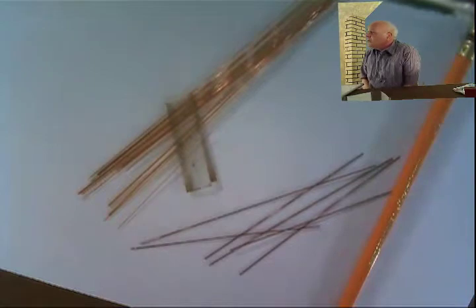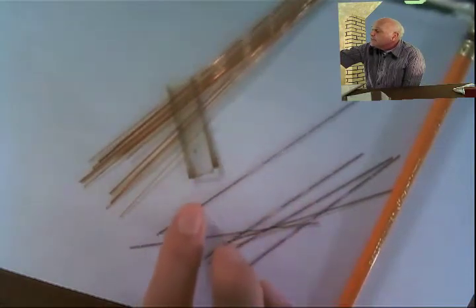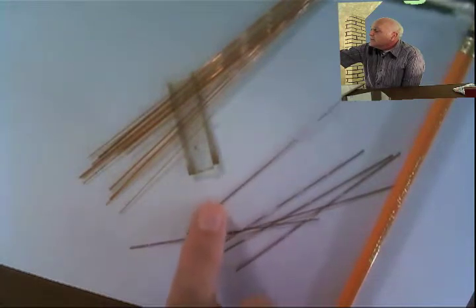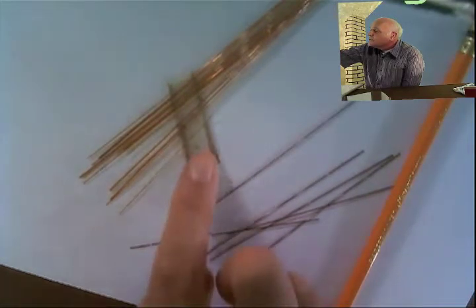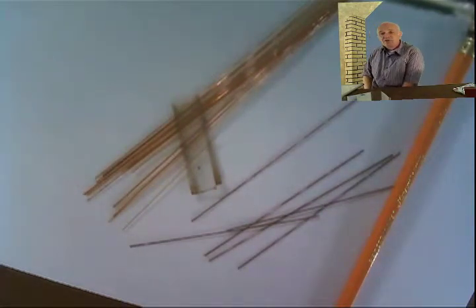Let's take a look at the column itself. The column is so small it's hard to believe that it's actually hollow. This is the standard 8270 column. This, I believe, is a megabore. I found these in a file, so I'm not exactly sure, but I think this is the megabore from the 8240, which is the volatile GC mass spec. It's small to the point that it's just incredibly small, and it's 30 meters long. So I don't know, anyway, that's the way it is.